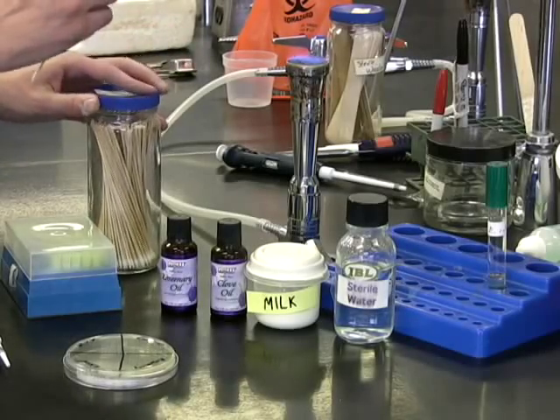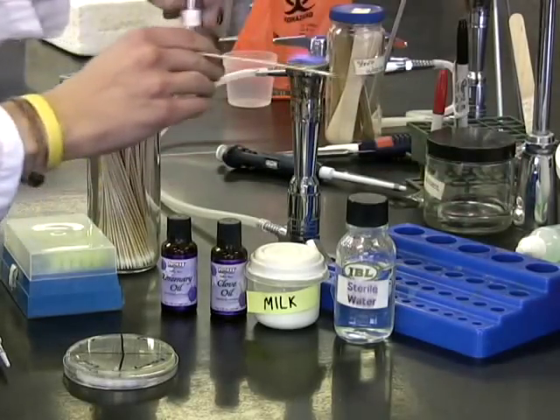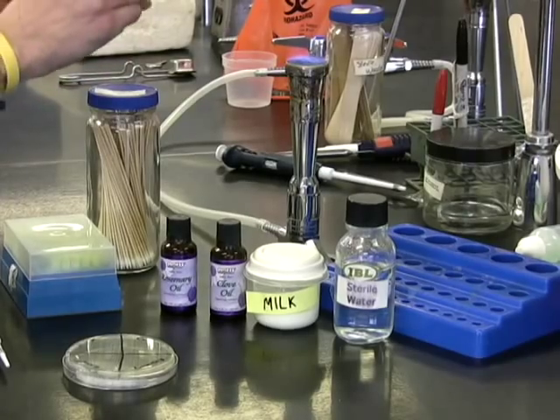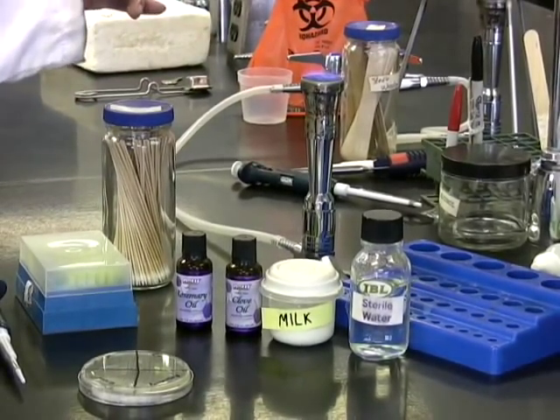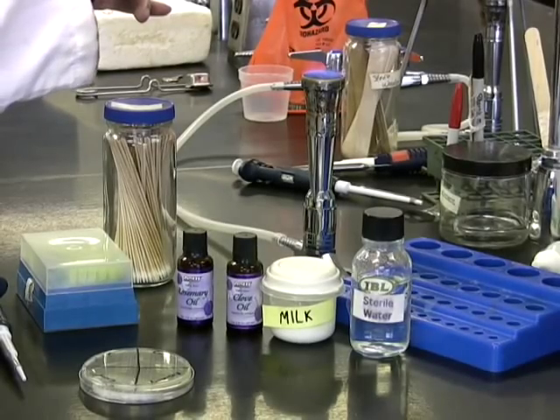For this procedure, we will be testing both E. coli and Staphylococcus aureus for their susceptibility to a variety of antimicrobials found in food. While you will be testing both bacteria, we are just showing E. coli here.